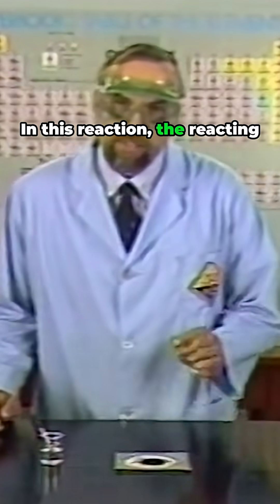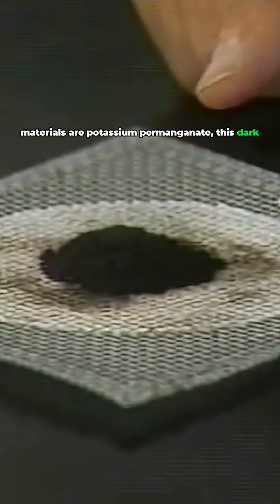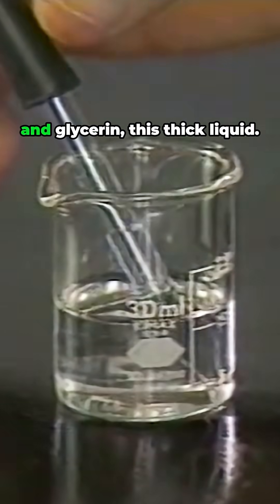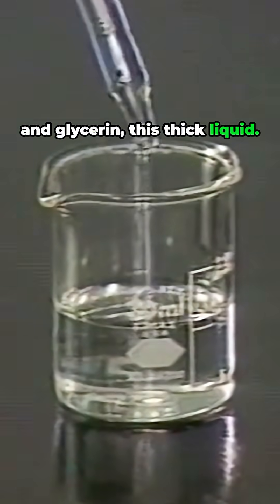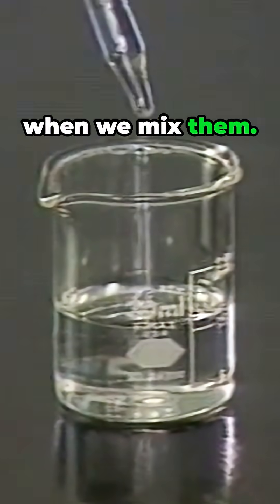In this reaction, the reacting materials are potassium permanganate, this dark purple solid on this screen, and glycerin, this thick liquid. Now let's see what happens when we mix them.